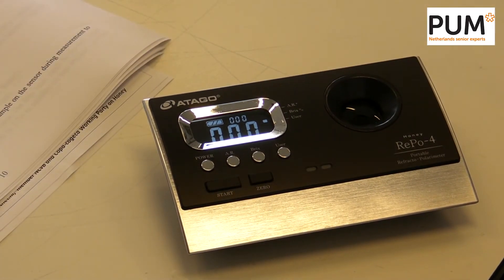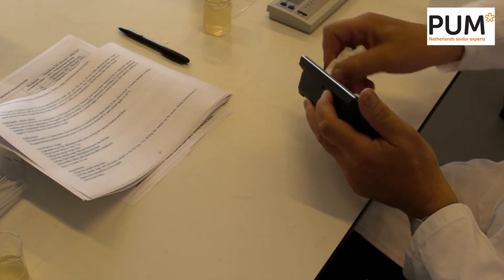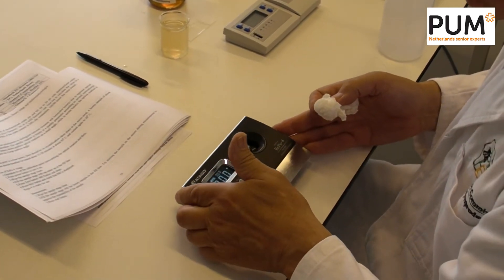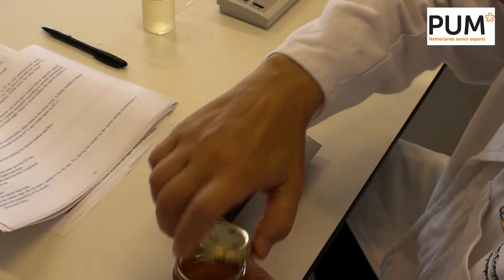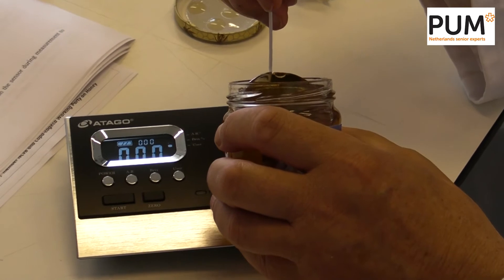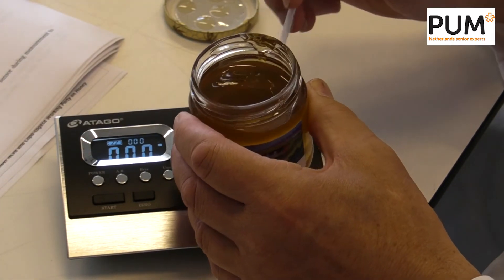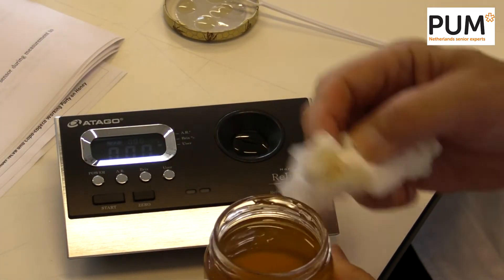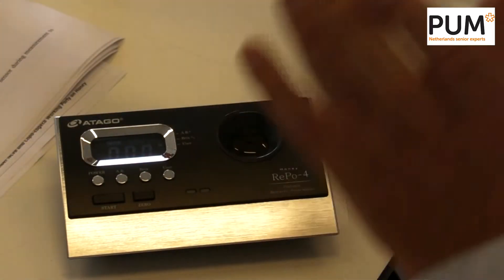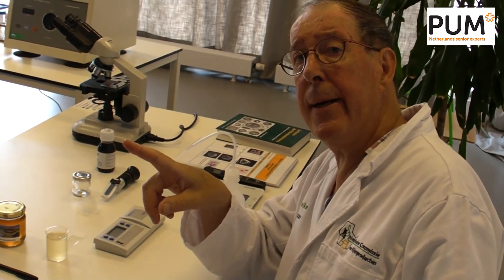What we are doing now is cleaning it up — the water should come out. Clean it once again thoroughly, leave the system on. Check if the mirror inside is very clean, and when it's very clean again, we take the honey sample and fill the same area with the honey. Pay attention: you can only do this with completely fluid honey — not crystallized honey, only fluid honey.